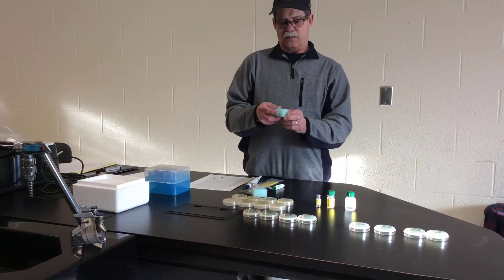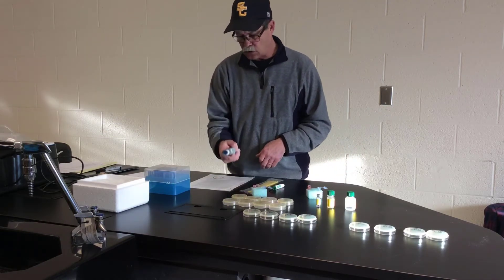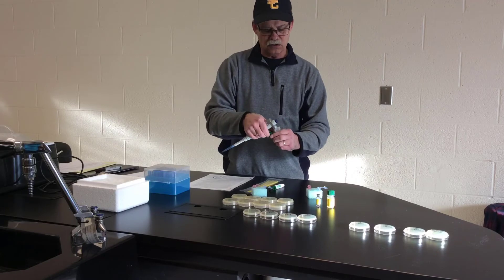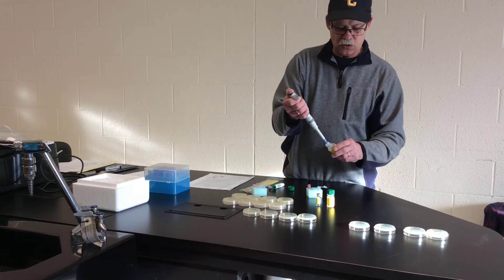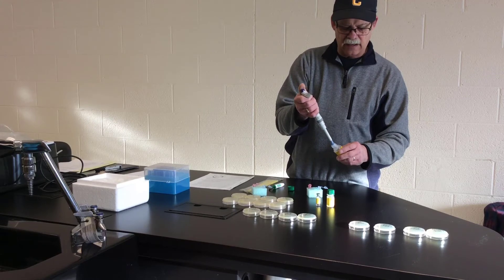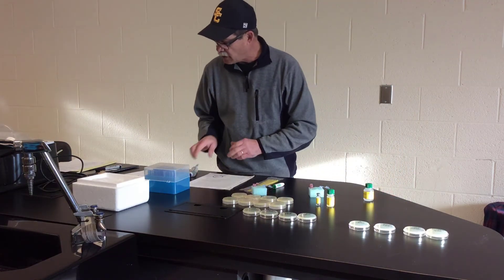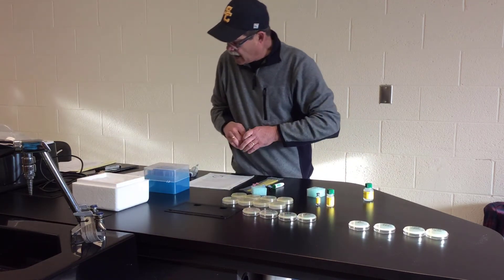We have a positive tube labeled for the pGLO plasmid and then the negative. The first thing the procedure tells us to do is add 250 microliters of the transformation solution using an analytical pipette. The transformation solution is actually just calcium chloride, which serves to make the plasma membrane of the E. coli a little more flexible and allows for the entry of the plasmid. So we've added 250 microliters and will place these tubes in crushed ice.